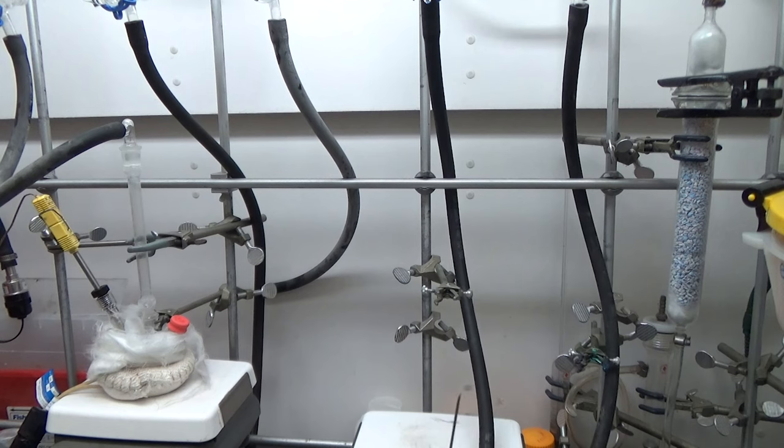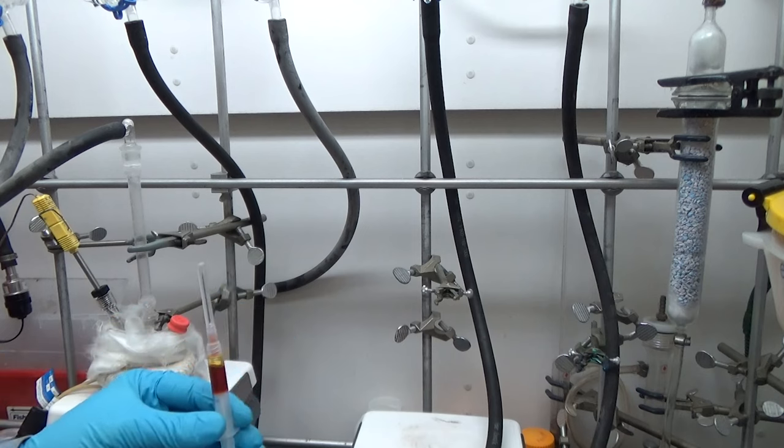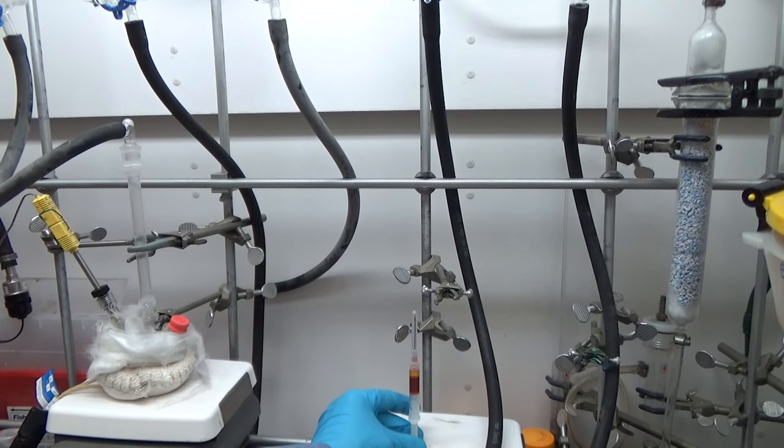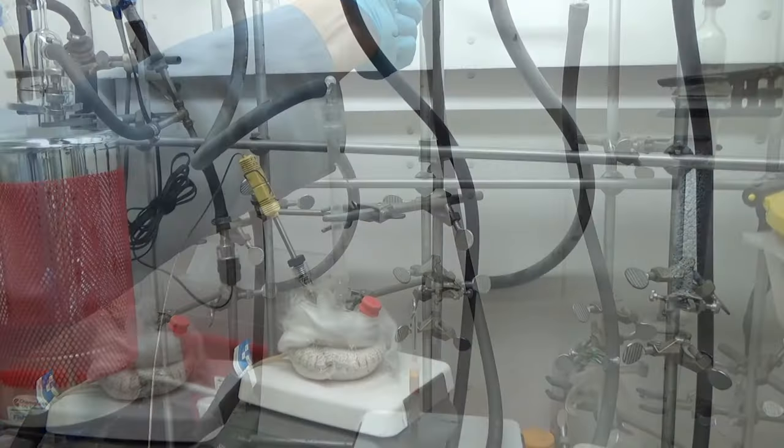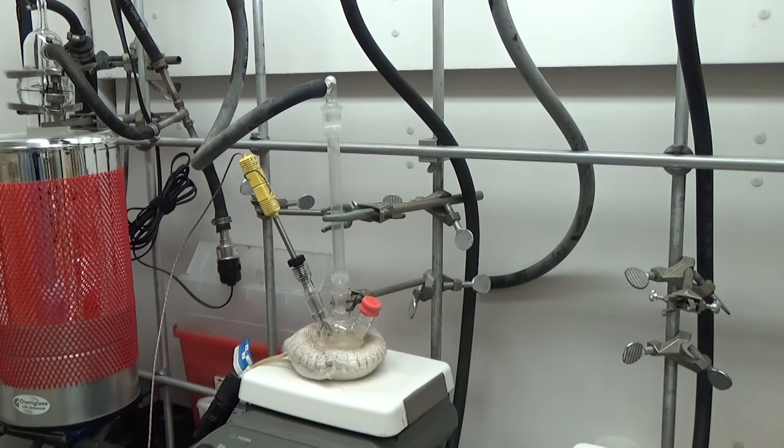And as soon as I take it out, I put a cap on it because the solution still, the zinc and cadmium octadecene has to get up to 310. So we're heating that up and that's of course under nitrogen. Don't forget to put it under nitrogen during the heat up.